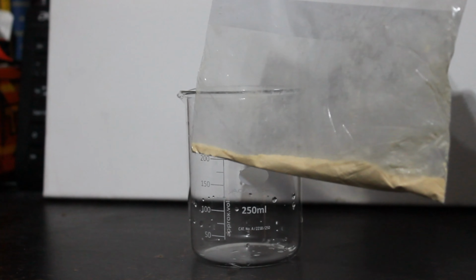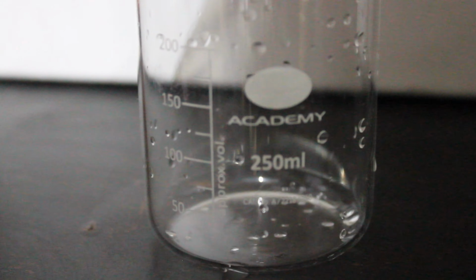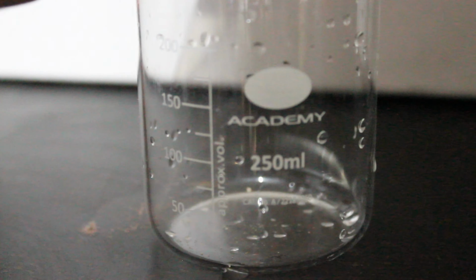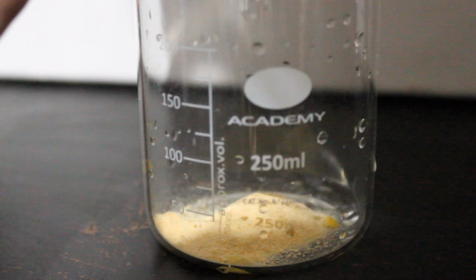For this one, we first need to crush up a 1 gram vitamin C tablet, whilst also taking out my annoyance of the situation. This is then added into a beaker, and hot water is poured on top. We'll call this Solution A.